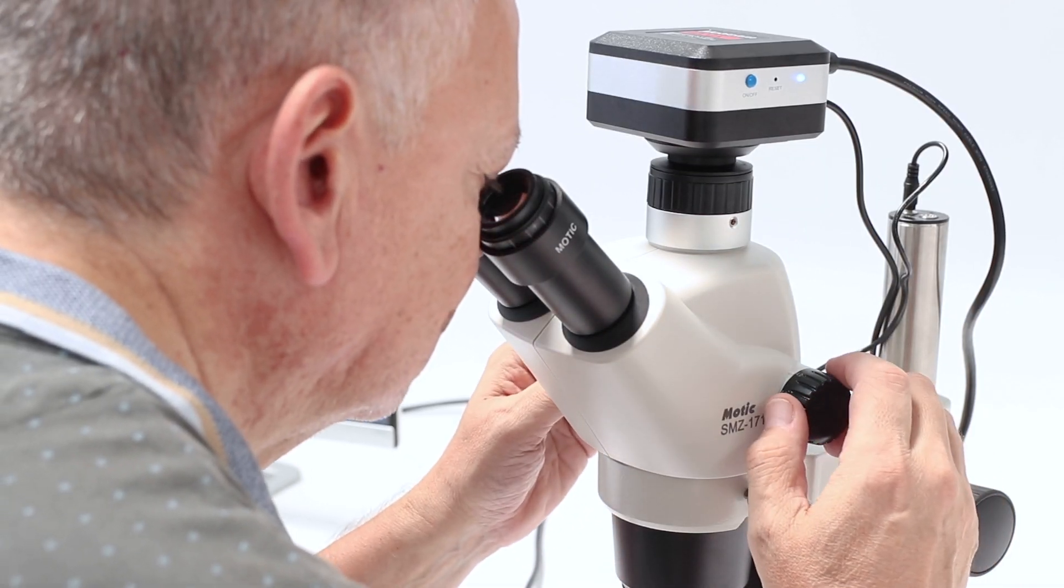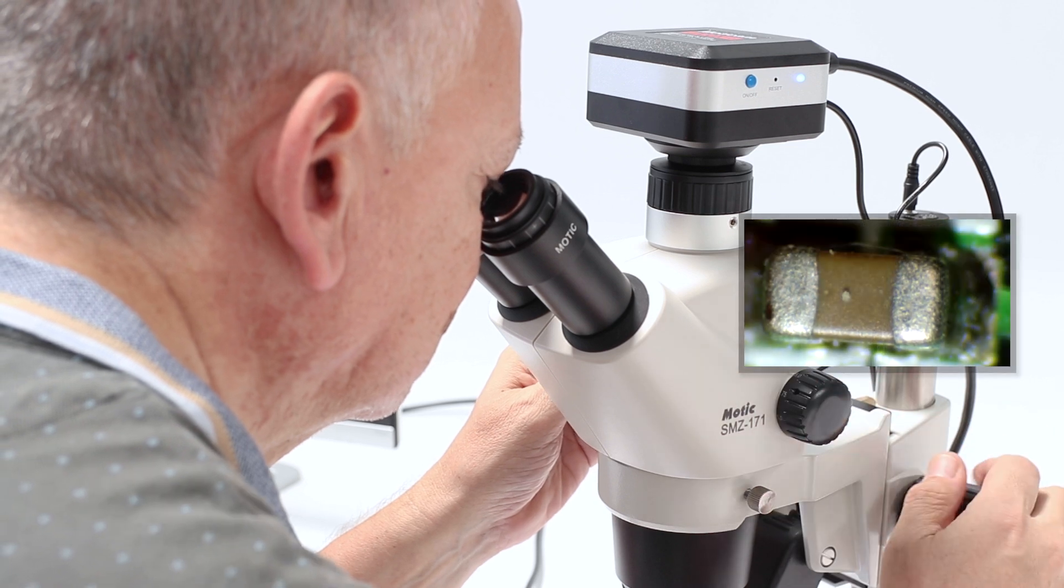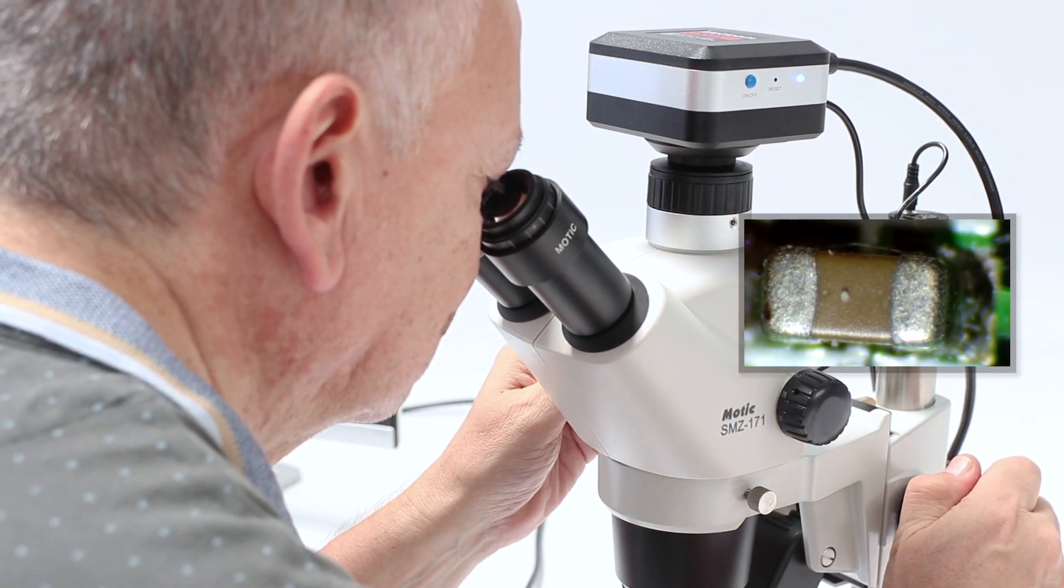With the 5x zoom magnification selected, focus your sample through the eyepieces using the microscope's focusing knobs.